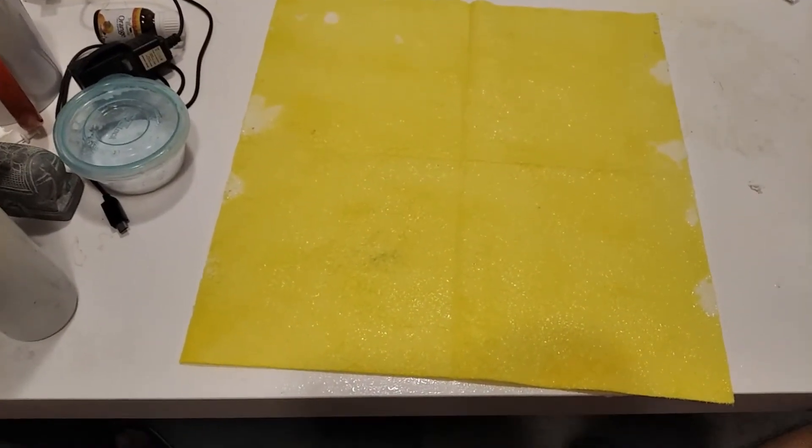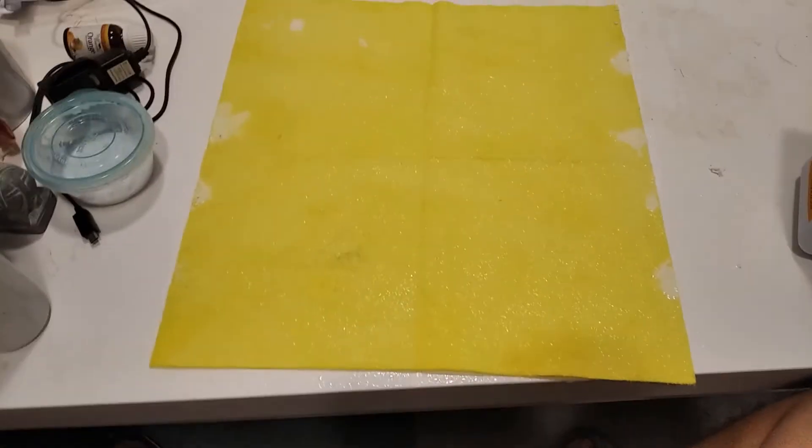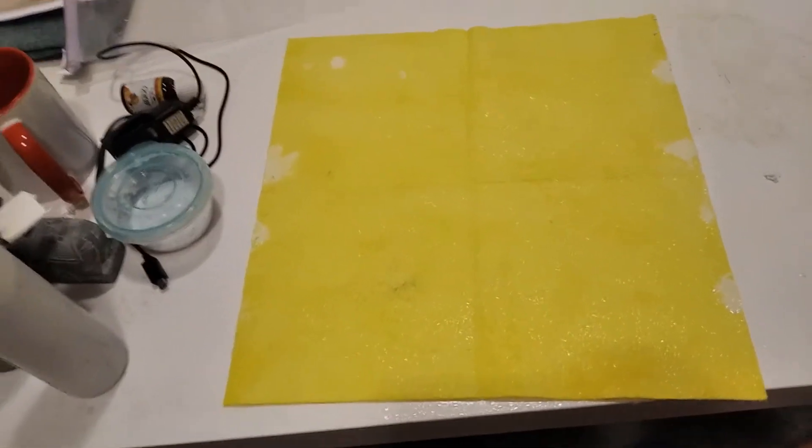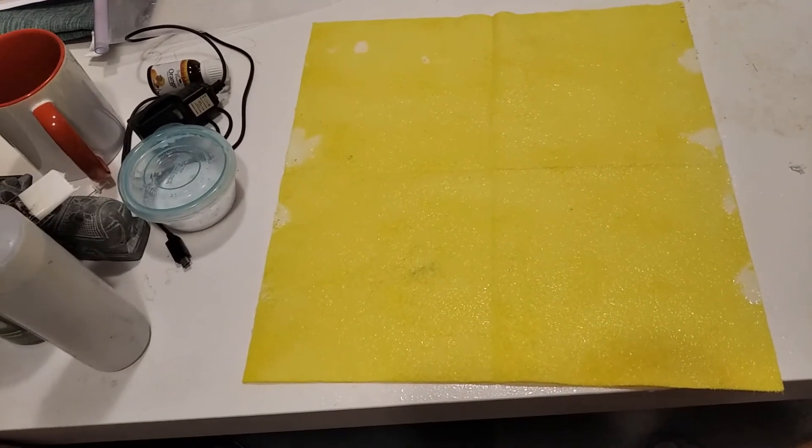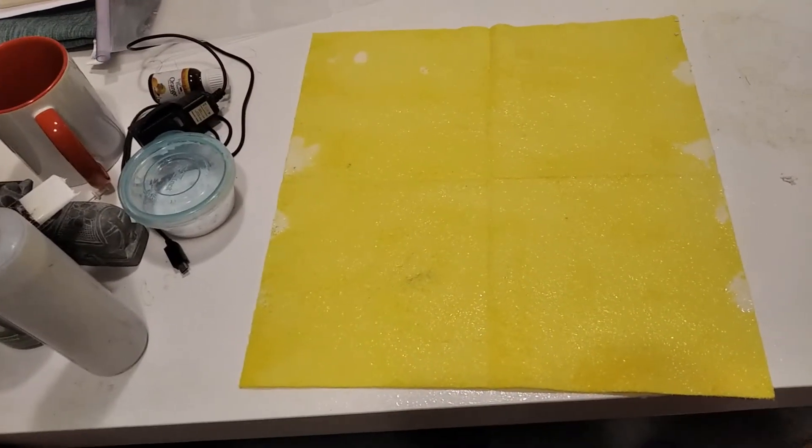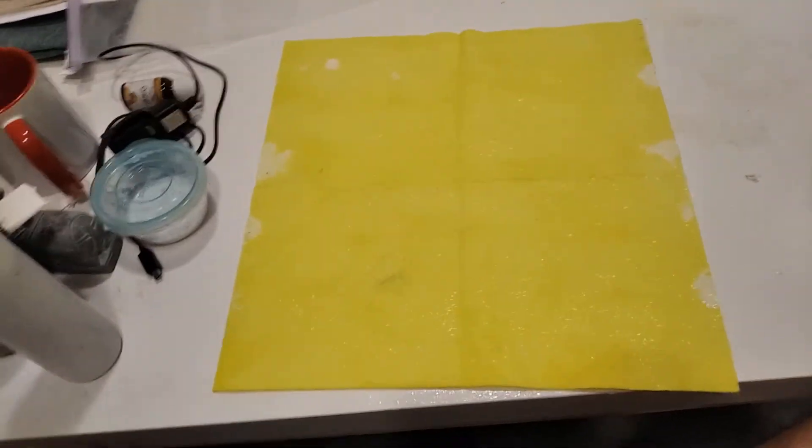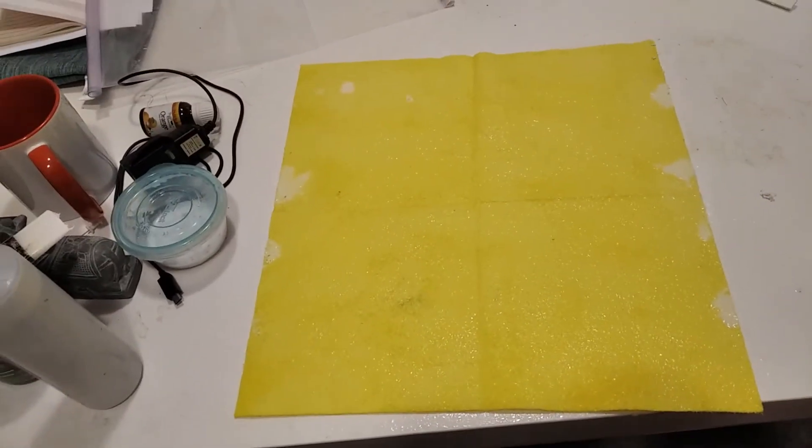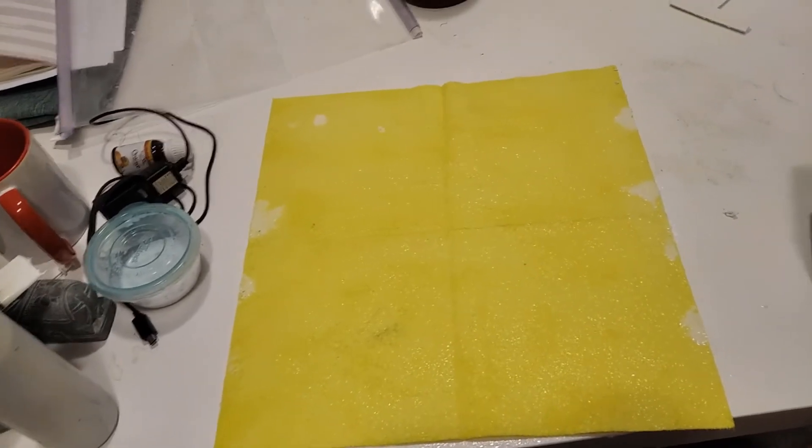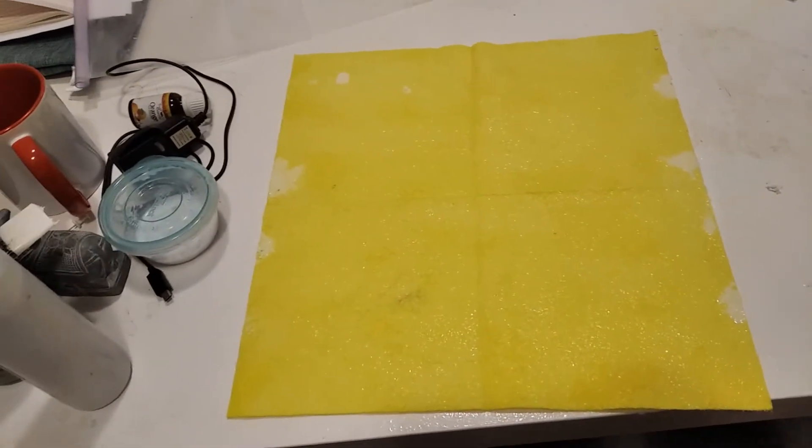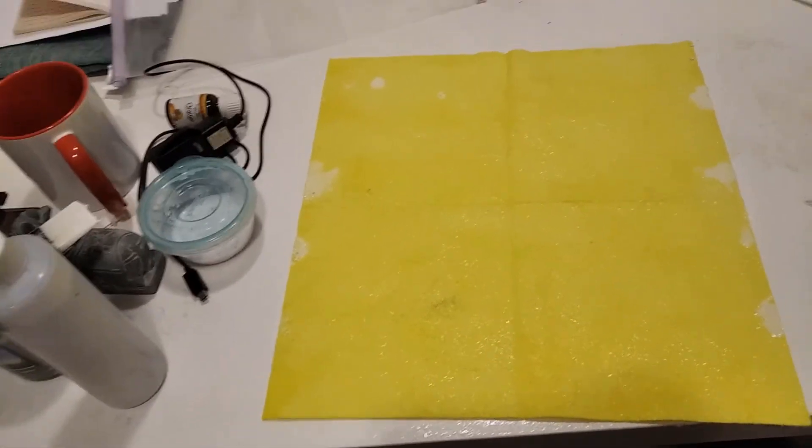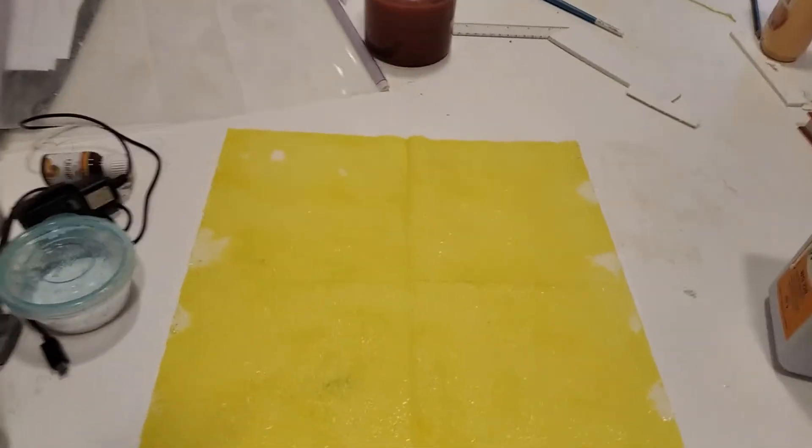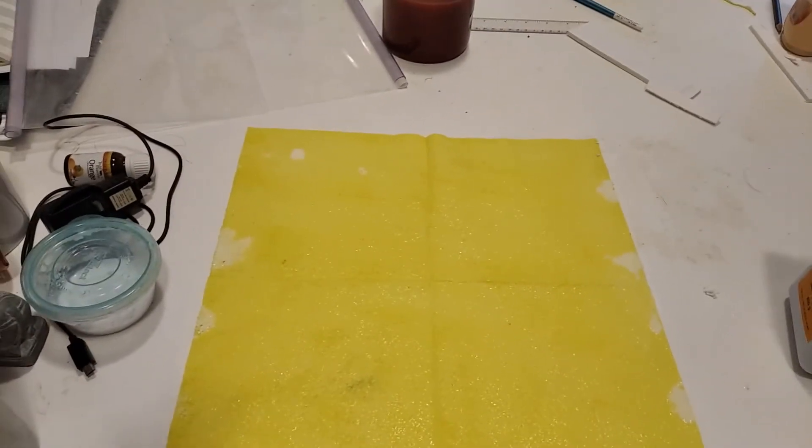Then you repeat the process five more times. After the last time, you then dry it for like a day or two until the thing becomes rock hard. Once it's hard, you can then cut this accordingly and put them in your chloroalkali ion exchange membrane cell.